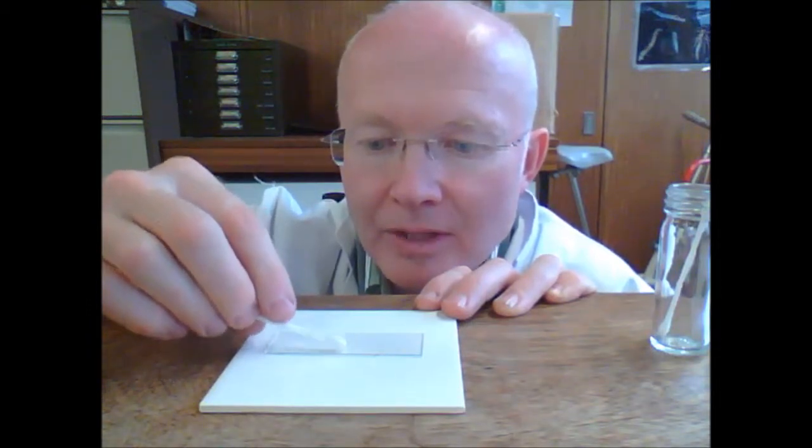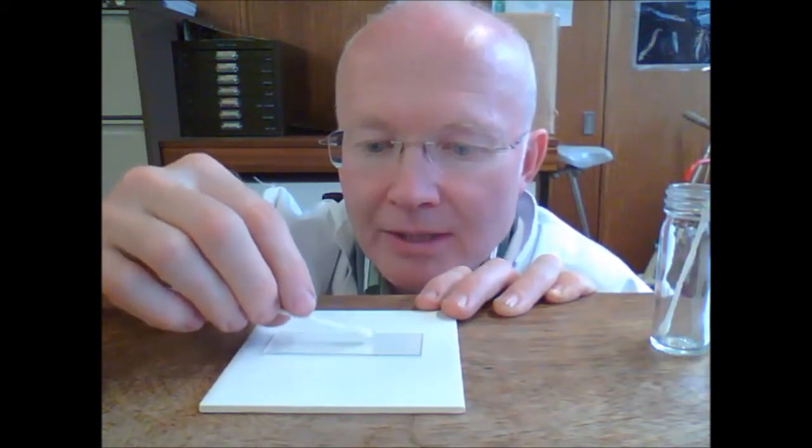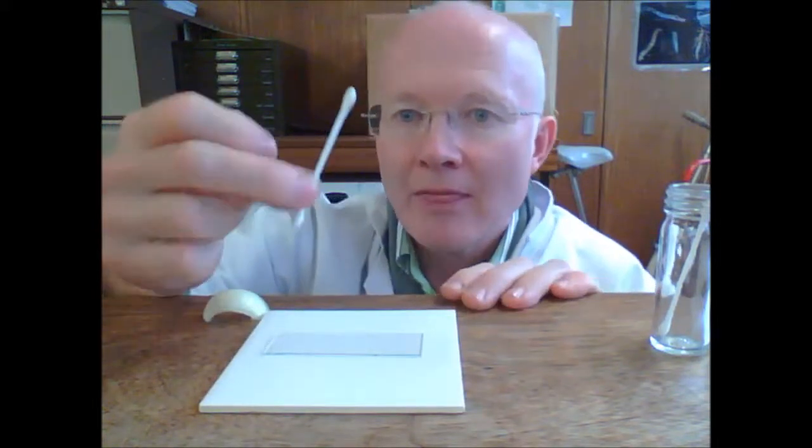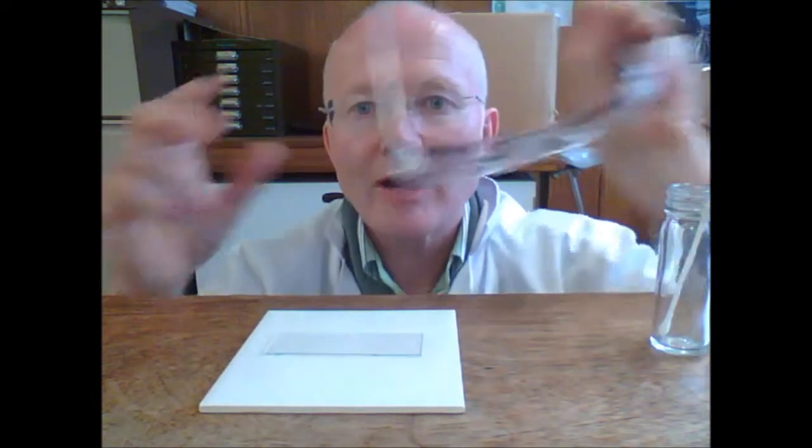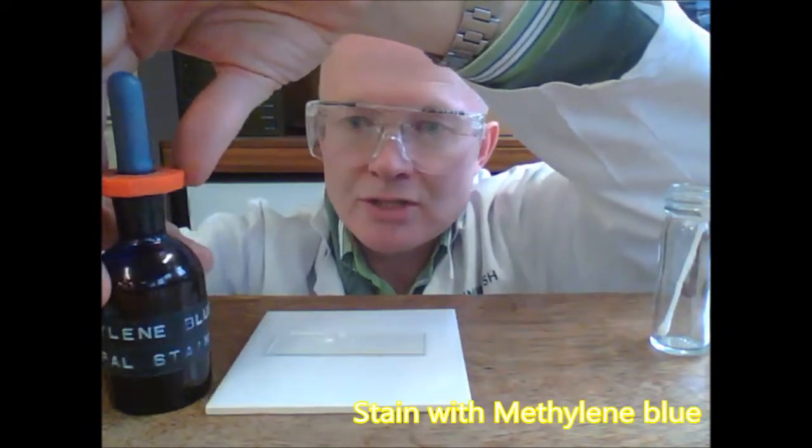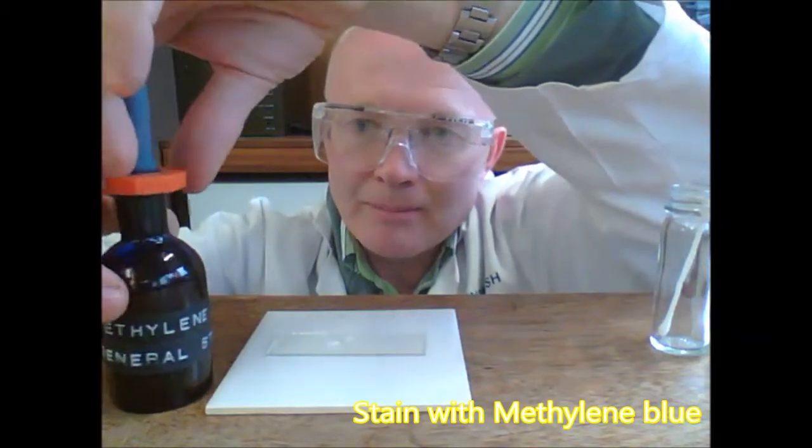Don't be too rough, just go around in different places on the middle. Okay, this then needs to go into antiseptic. The next thing is going to be to stain the cells so we can see them. To stain them, you will need to wear eye protection. The stain we're going to use is methylene blue.